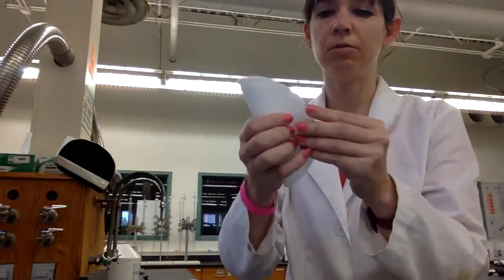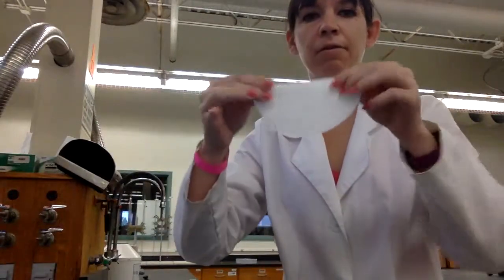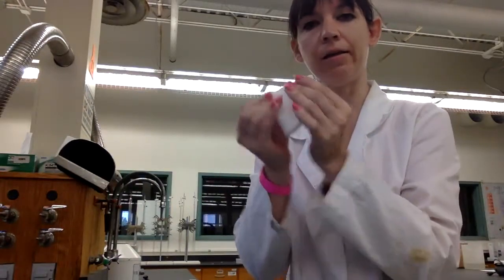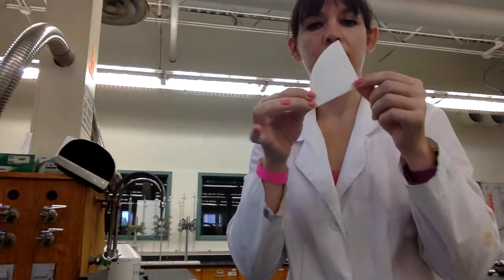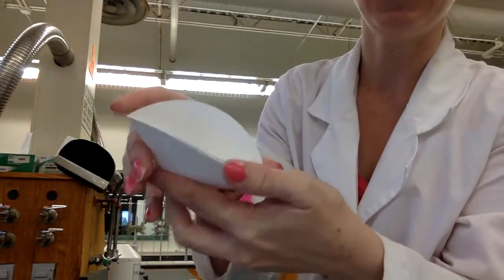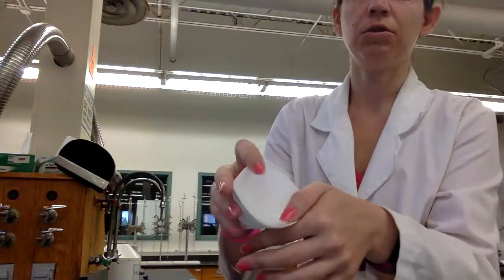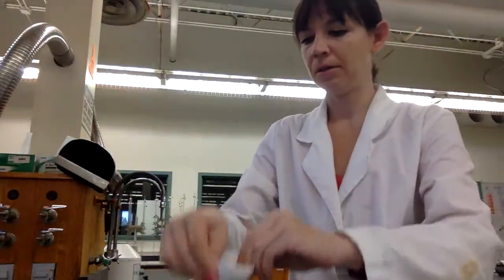All you're going to do to begin with is fold it in half. Okay, so now I have a half circle. I am going to fold it in half again. So now I have a quarter circle. And if you look close at this now, you'll see that you kind of have two little pockets that you made. All right, so you want to open one side, either pocket, it doesn't matter.